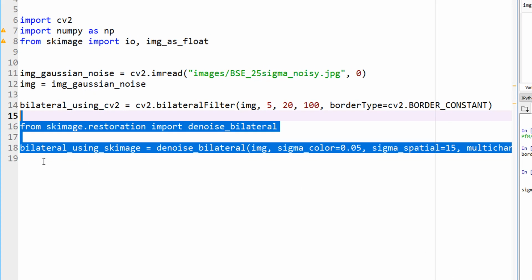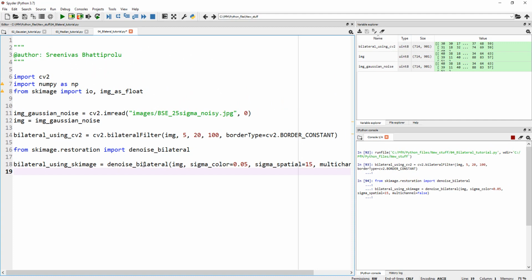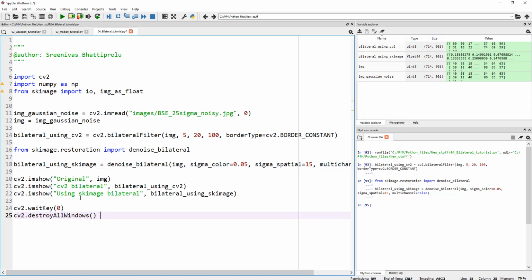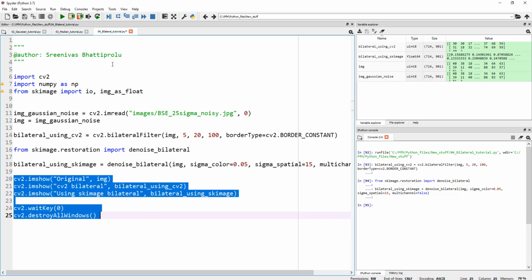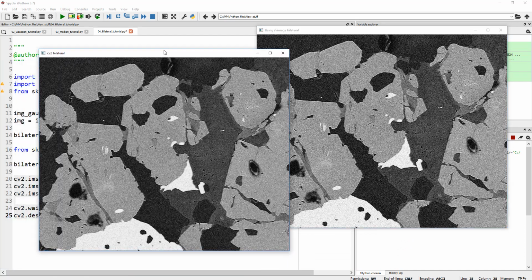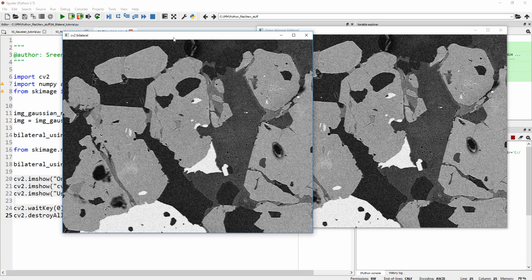I realized that the bilateral in scikit-image is a lot slower than the bilateral filter in OpenCV. Again, I haven't looked into their individual implementations, but this is one thing I've noticed just by using this. Okay, there you go. It took a little while, and while it was doing that, I typed our imshow commands over here, so we can have a look at these images. So let's run these lines, and let me bring my images from the other screen. So this is using skimage, and here it is using cv2.